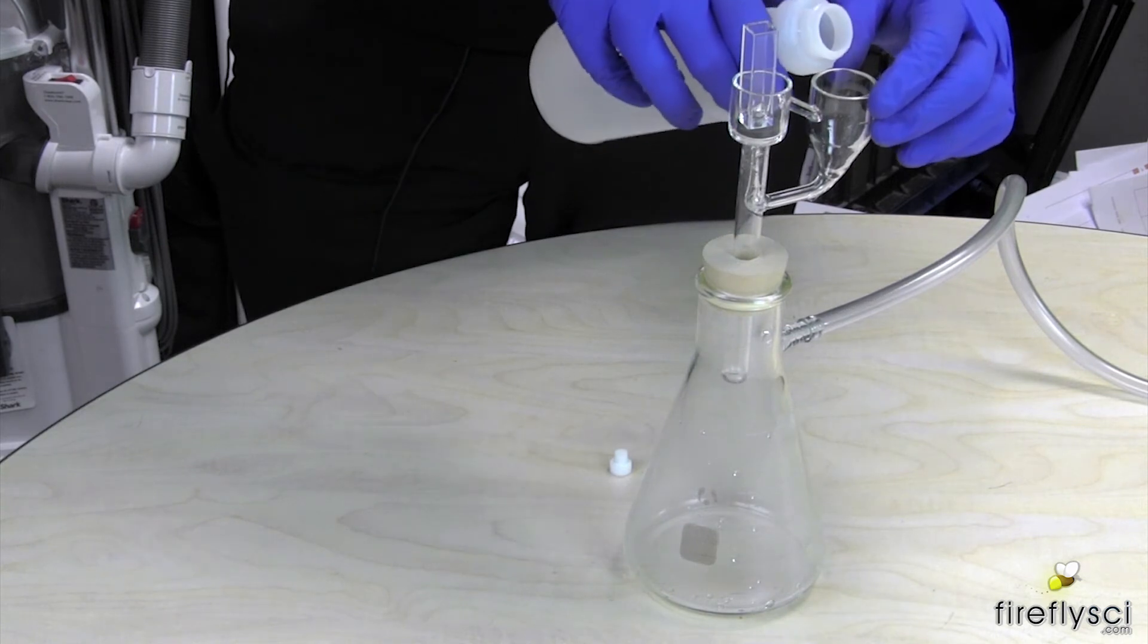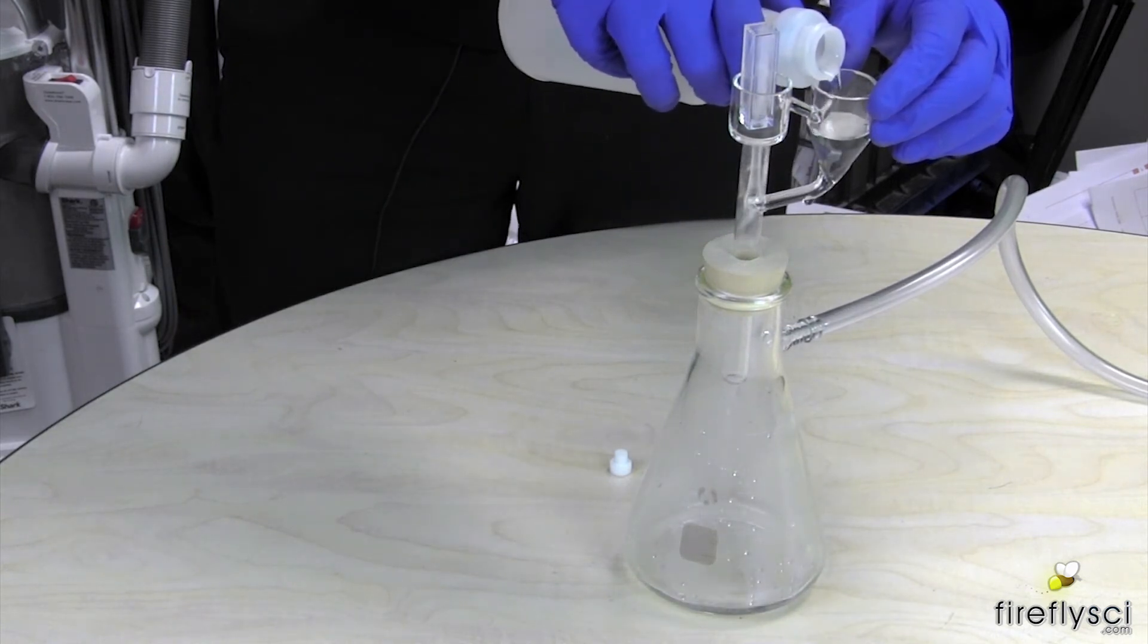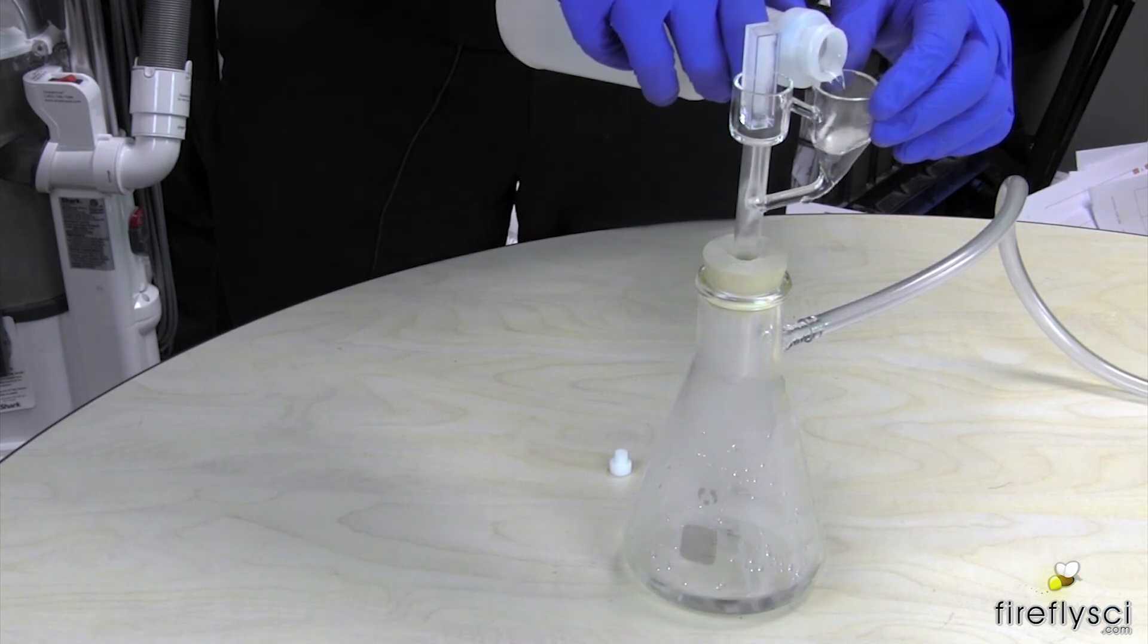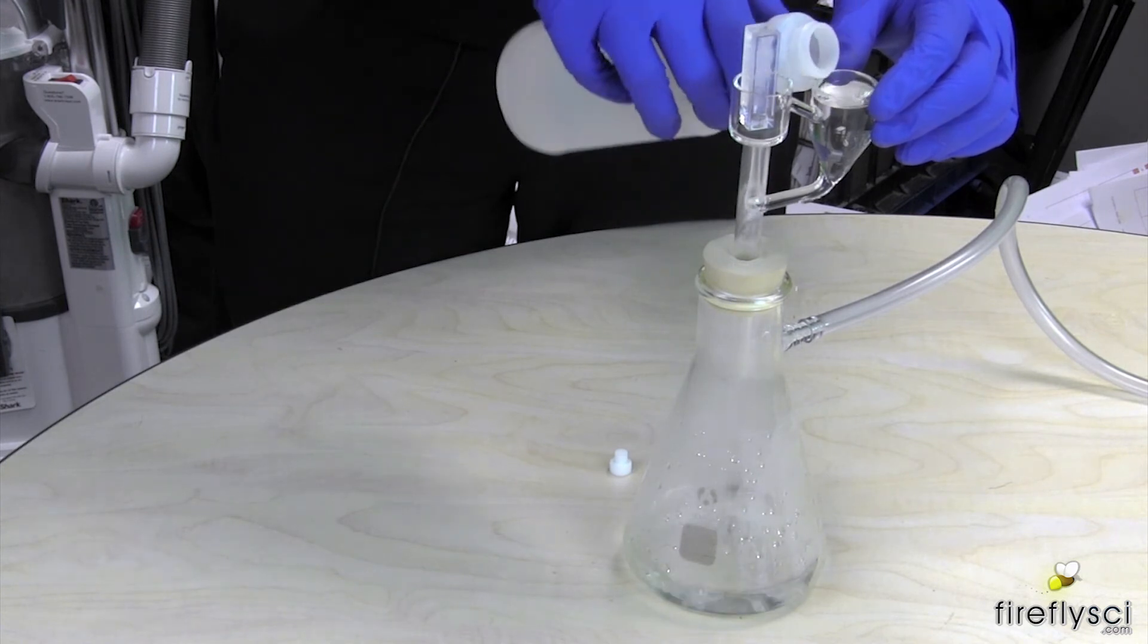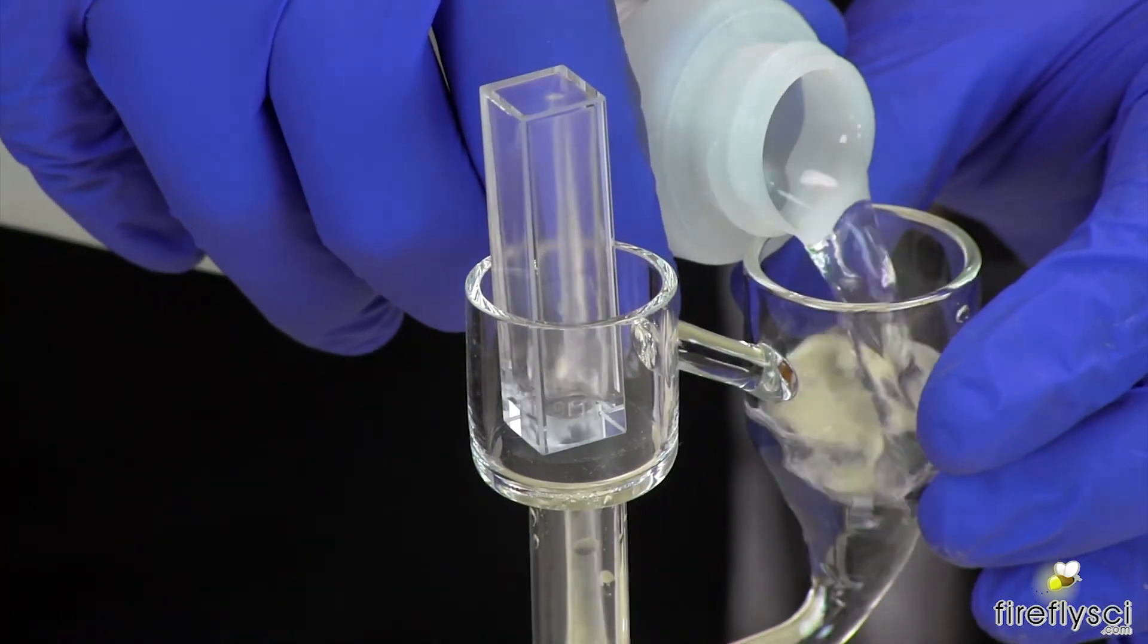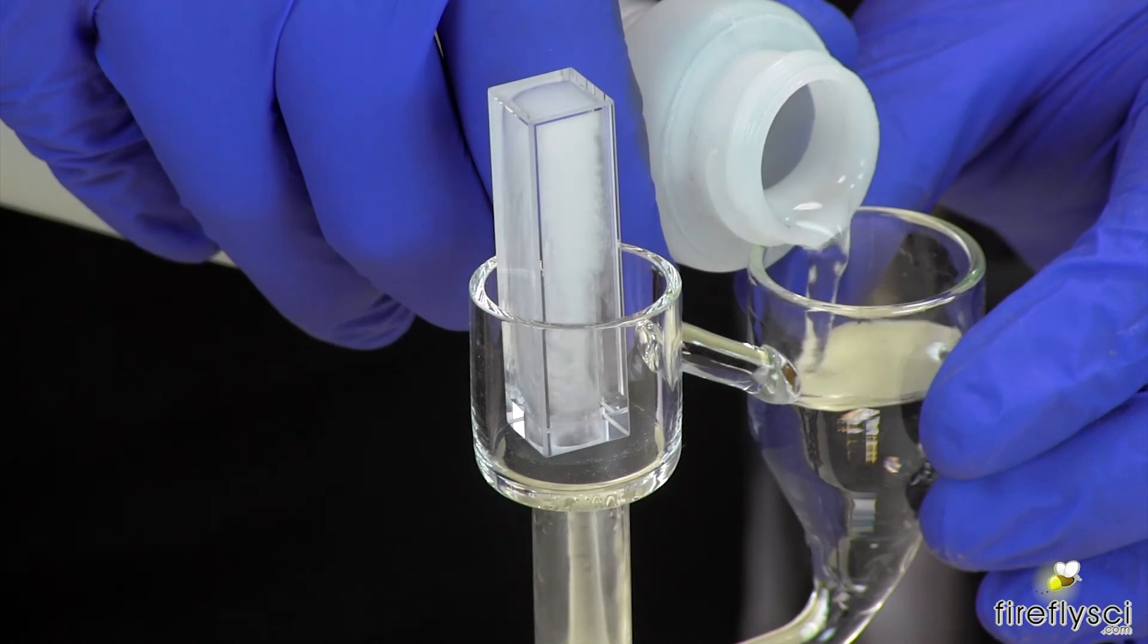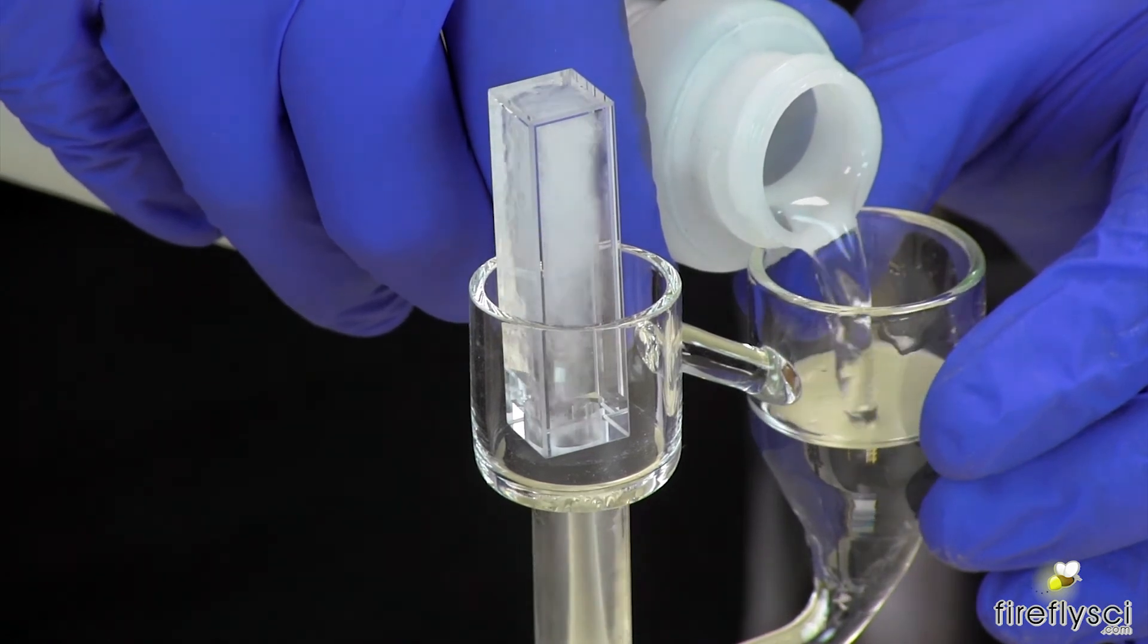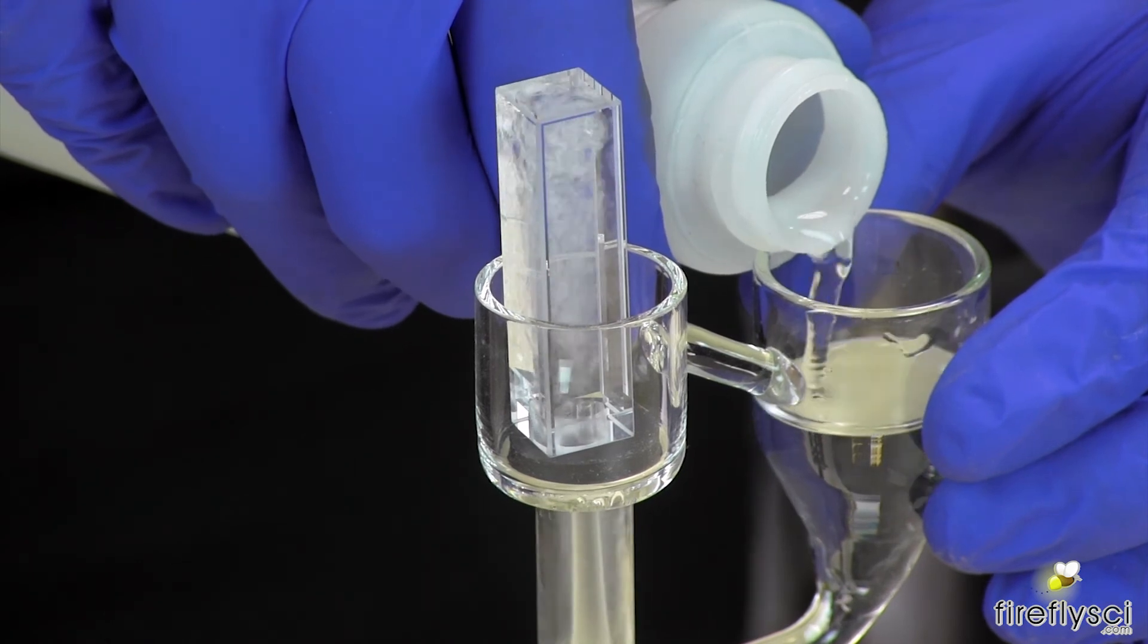Beautiful. You can also add solution continuously, so it washes in a continuous cycle. I love that dishwashing action when you use this.